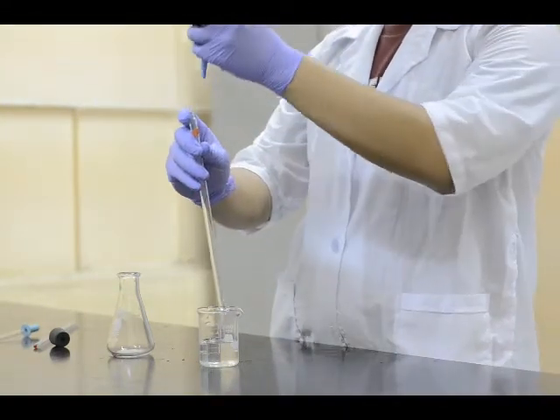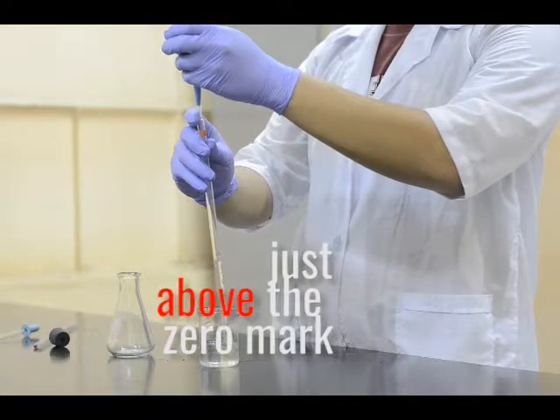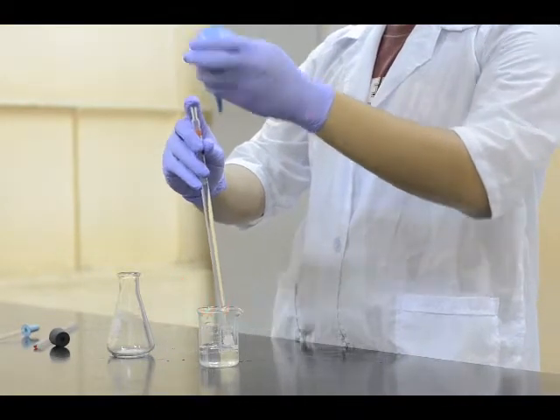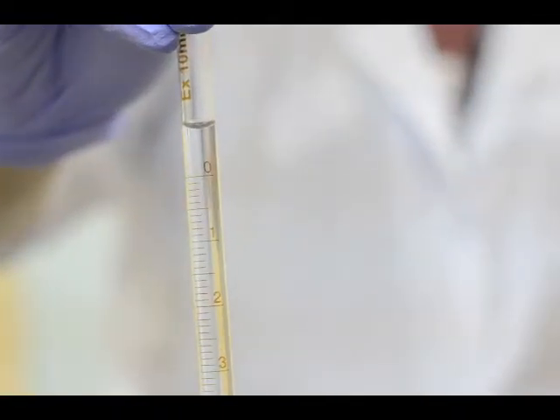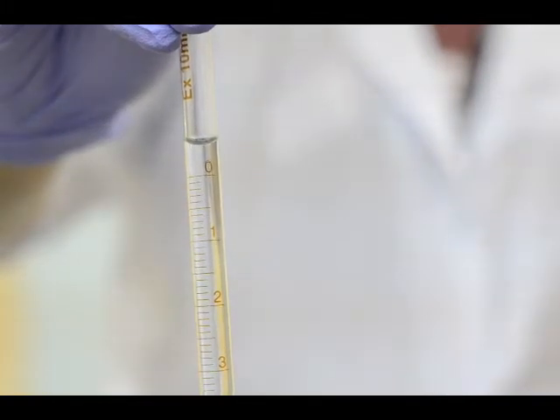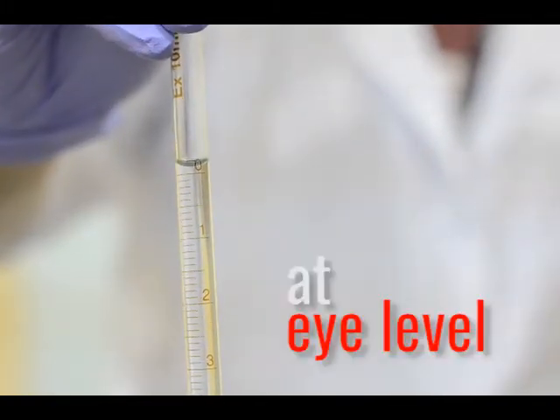He draws the liquid up just a little beyond the zero marking of the pipette. He slowly expels the water up to the zero marking, measuring it by looking at eye level.